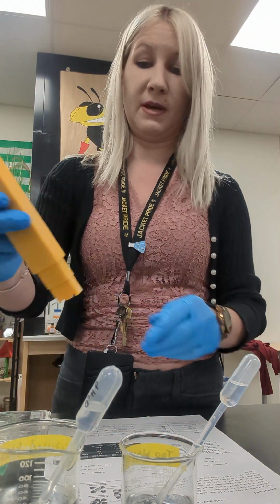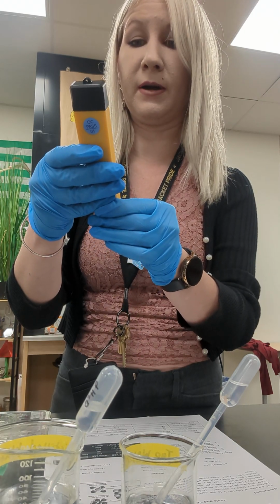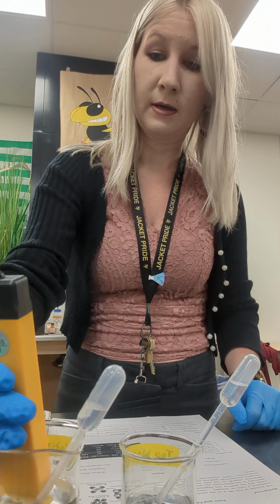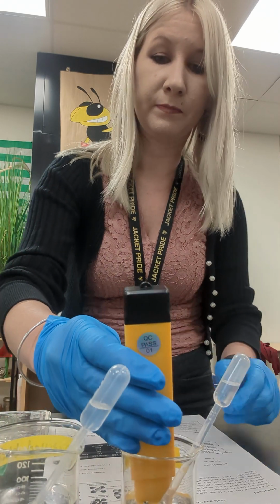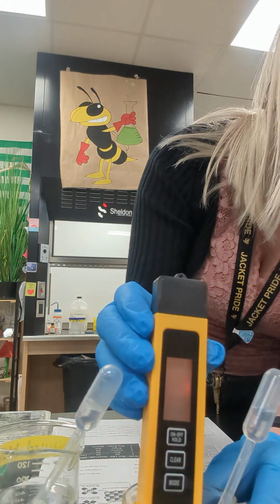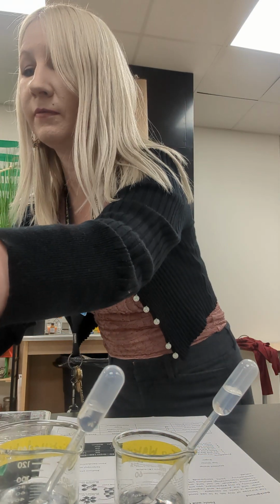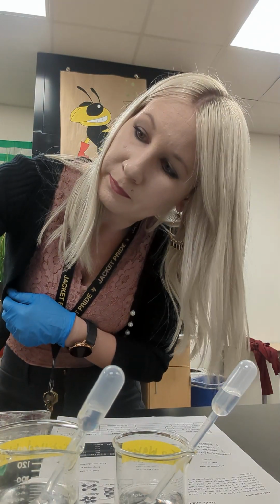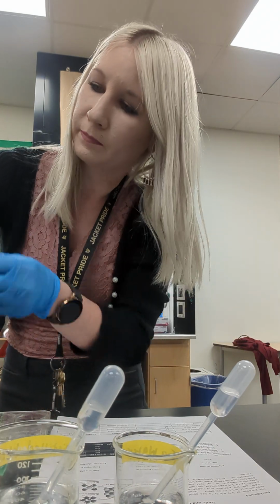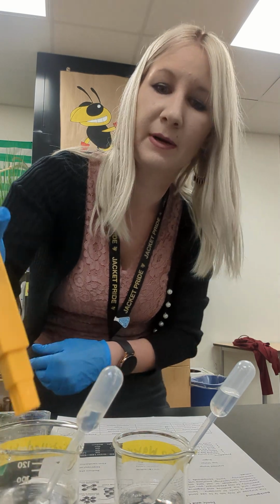And let's go ahead and use the meter. Put it in EC mode, electrical conductivity, which is going to be in microsiemens per centimeter. For distilled water, that's an 8. I'm going to rinse it. And for tap water, wow, it's going pretty high. 186. Rinse it off. You can also see in the rinse that the electrical conductivity is going down to a 32. It looks like my rinse is a little bit contaminated.